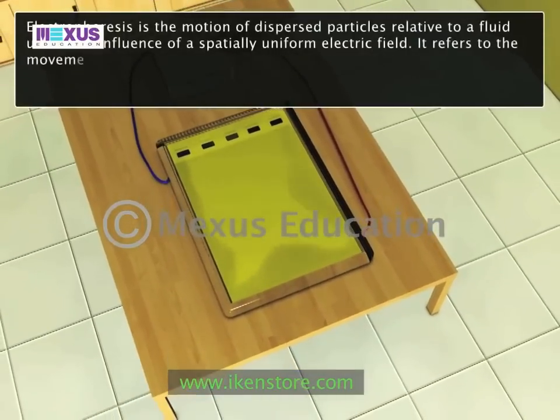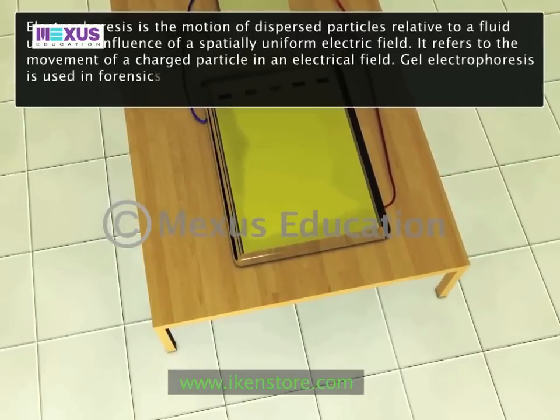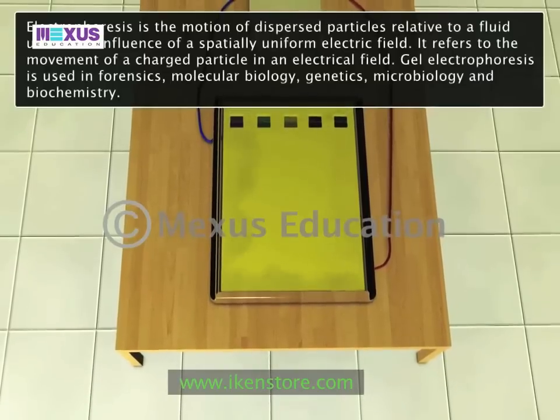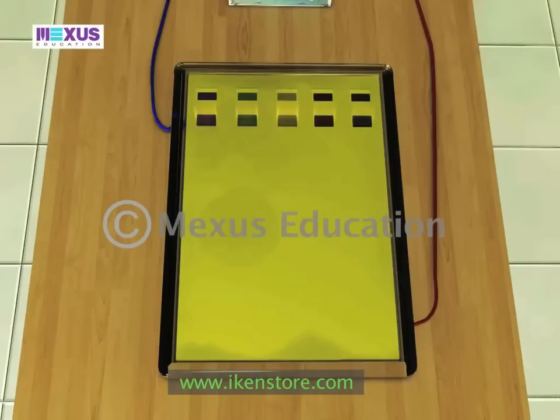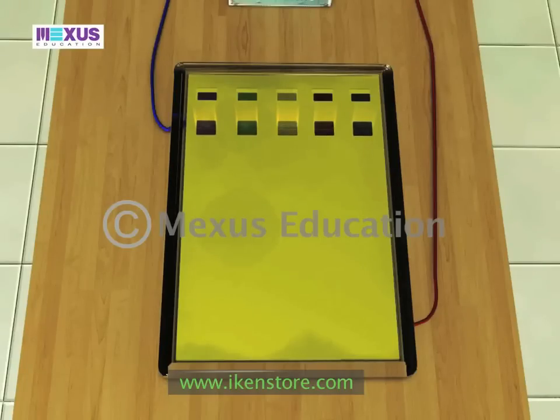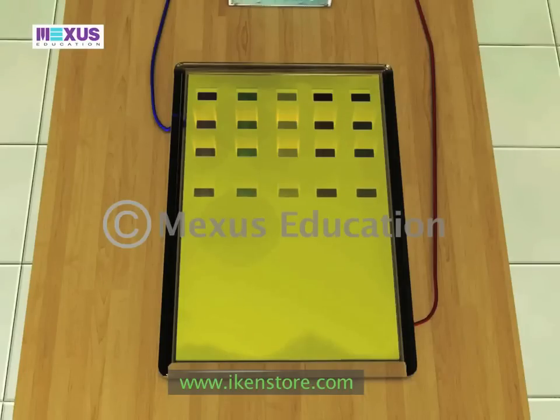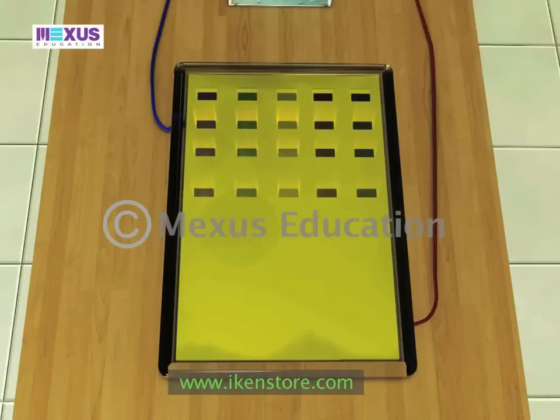Gel electrophoresis is used in forensics, molecular biology, genetics, microbiology, and biochemistry. Results can be analyzed quantitatively by visualizing the gel with UV light and a gel imaging device. The image is recorded with a computer-operated camera and the intensity of the band or spot of interest is measured and compared against standards or markers loaded on the same gel. The measurement and analysis are mostly done with specialized software, and other techniques are often implemented in conjunction depending on the type of analysis.